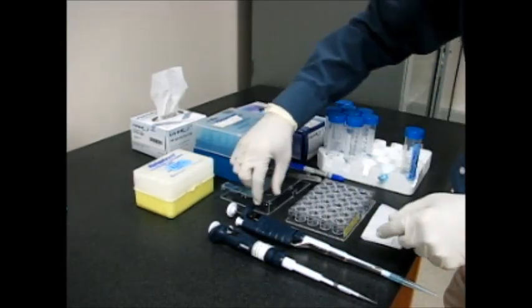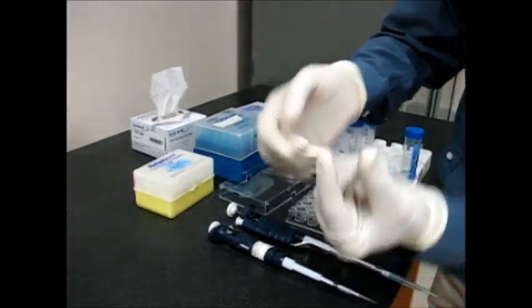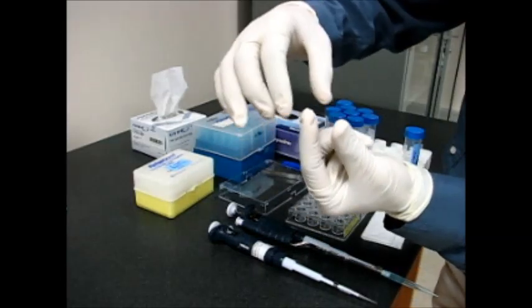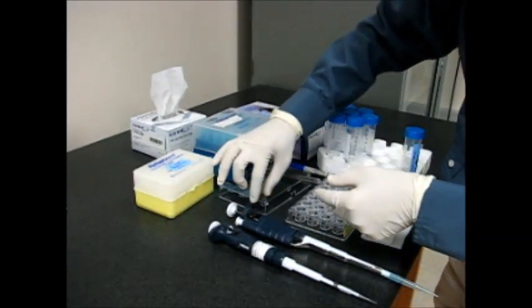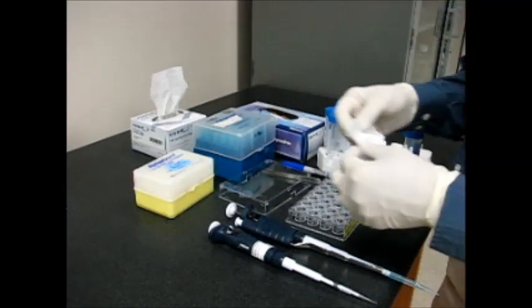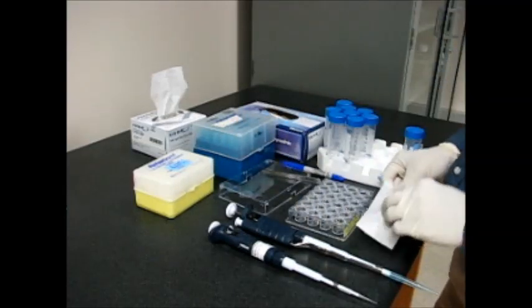We need forceps and a couple of siliconized cover slips in which we will mix the protein and precipitant solutions, and a small amount of tissue paper so that in case our hand gets greasy we can use it.